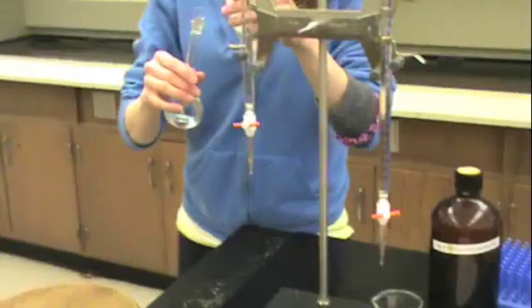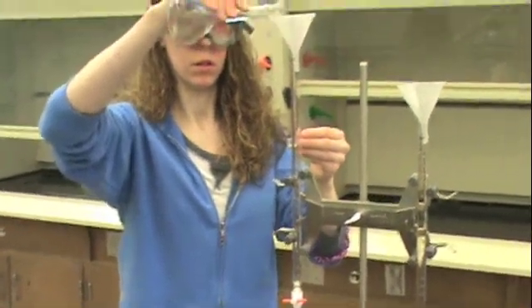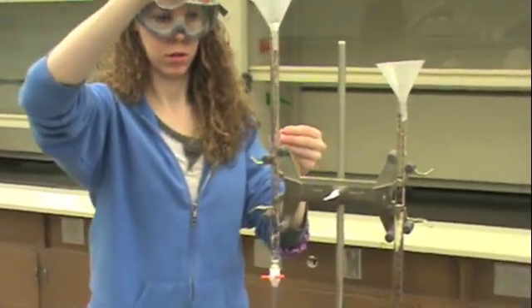In this video we will show you how to prepare a diluted solution. Take your concentrated solution and put it into a burette.